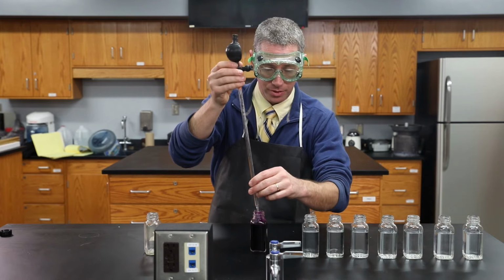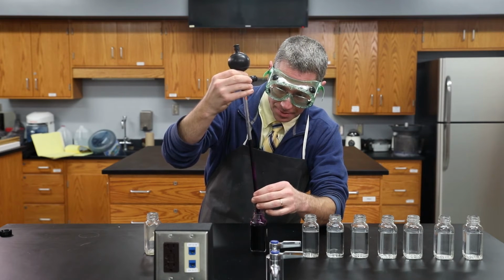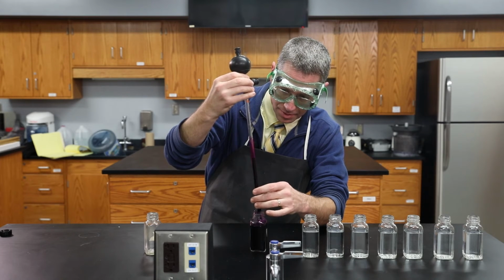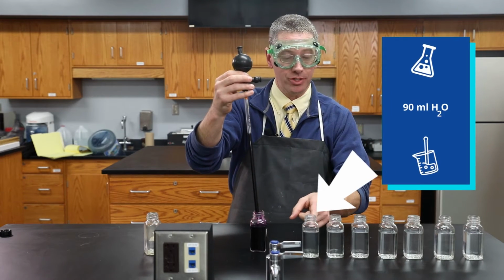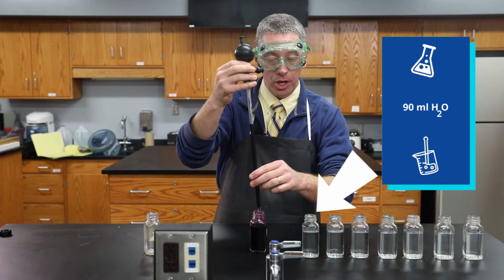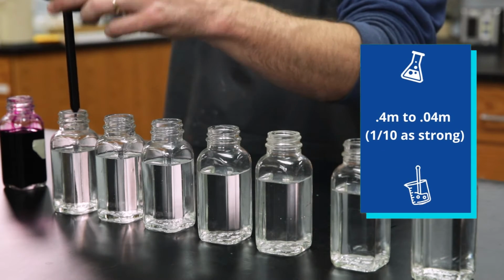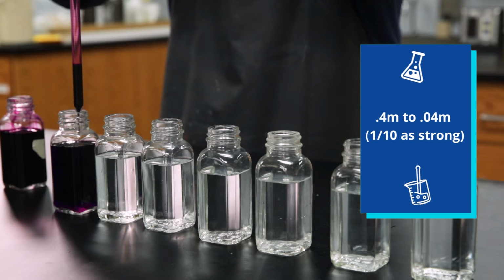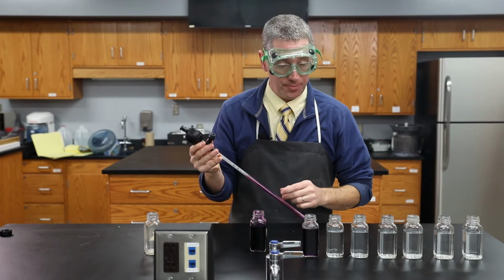That's exactly what I'm going to do now. I'm going to withdraw 10 milliliters. I'm going to take this 10 milliliters and put it into 90 milliliters of distilled water. That'll make the total volume 100 milliliters, or 1/10 of a liter, which will change our 0.4 molarity solution into 0.04 solution. So it's now 1/10 as strong as the original.